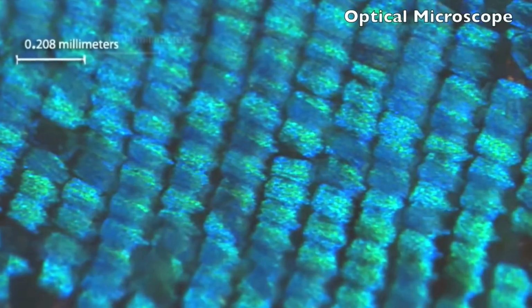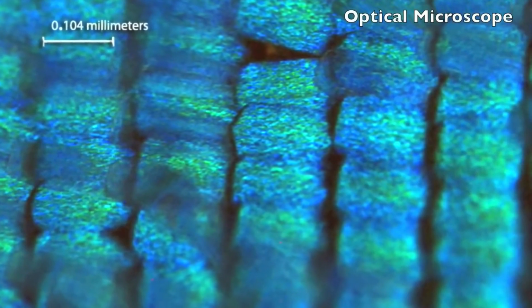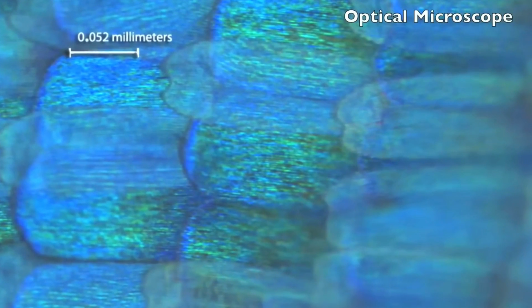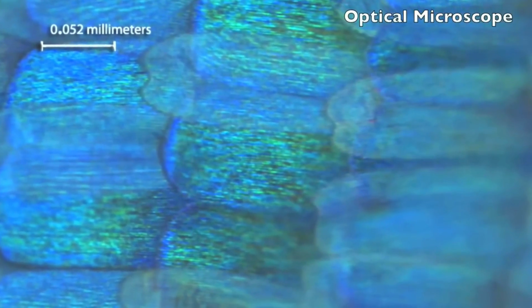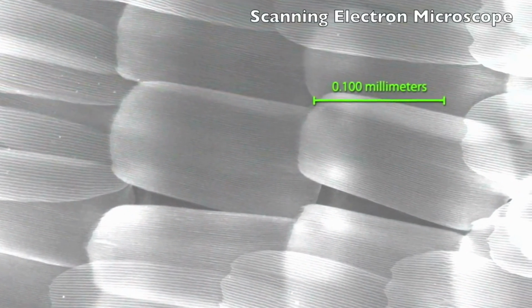With the optical microscope, we can go down to less than 1 millimeter, even less than half a millimeter, quite fine resolution, although it becomes very blurry and you cannot see the features clearly. You wouldn't see the traps for the light.